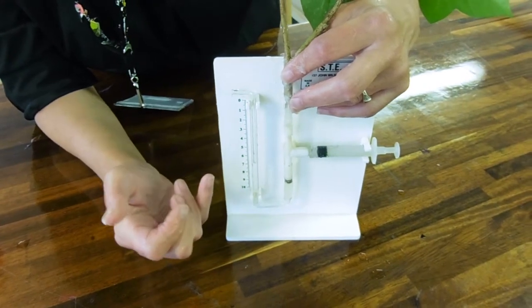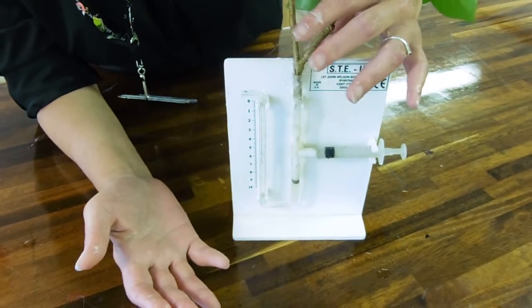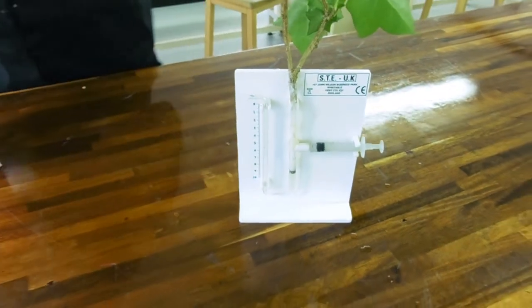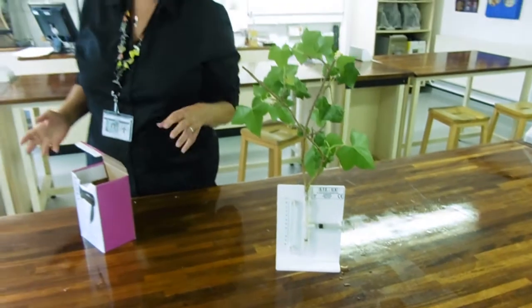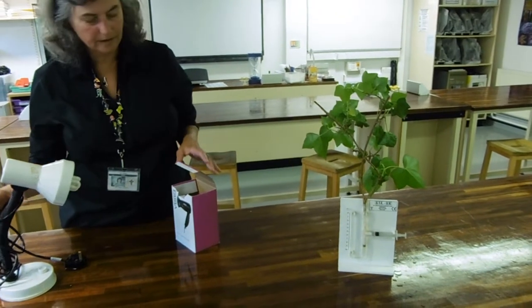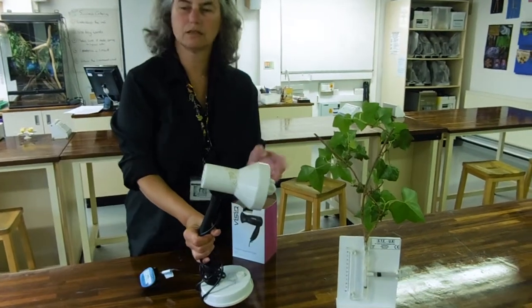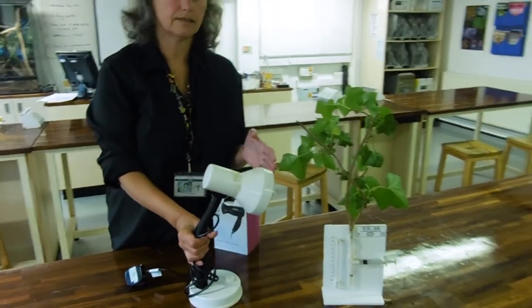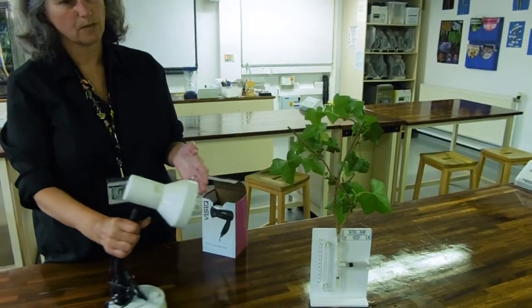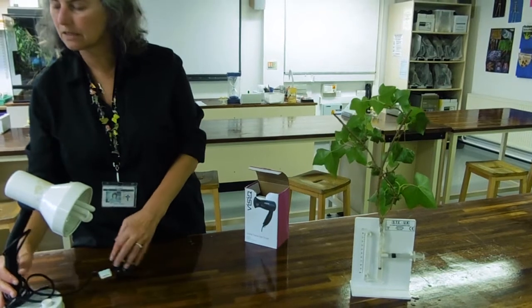Ivy goes quickly apparently, so a minute or two minutes will be fine; generally you might be talking five or ten minutes. As regards the independent variable, one of the things that influences stomatal opening is light intensity, so we can put a lamp close by the plant and move it further away to give it less and less light, a bit like in the photosynthesis experiments.